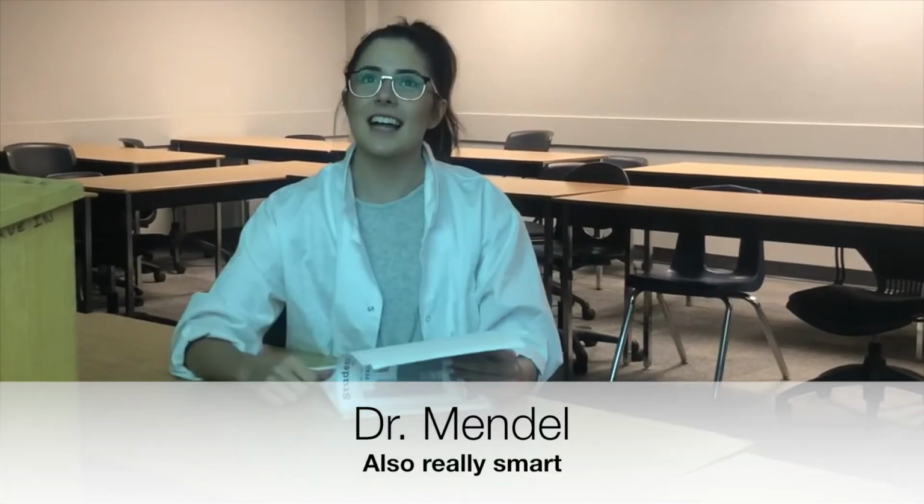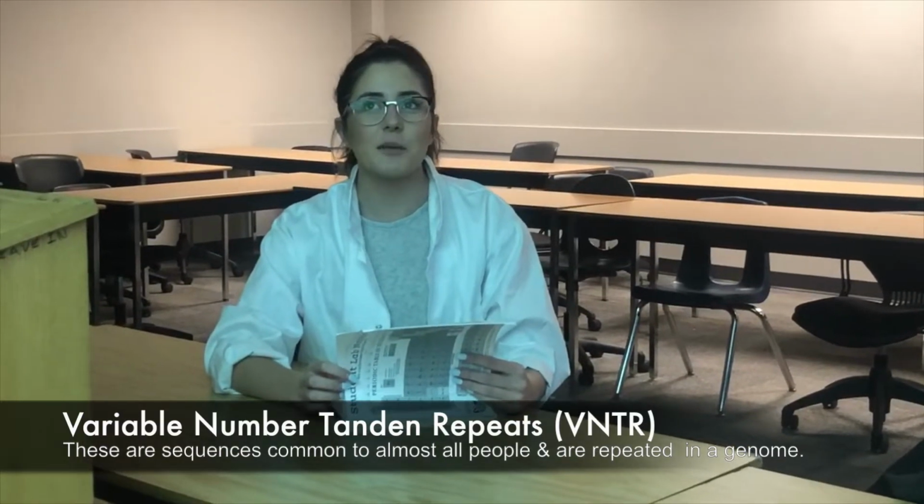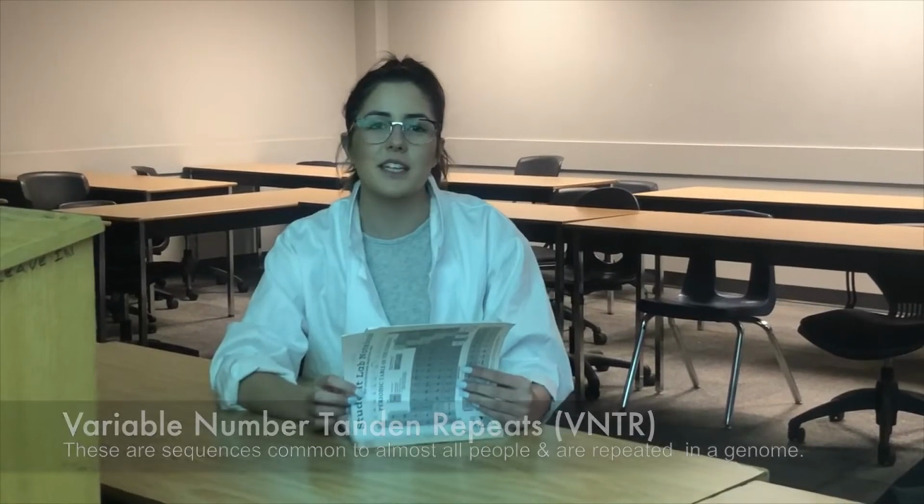The results of the forensic analysis were determined using variable number tandem repeats, known as VNTR. These sequences are common to almost all people and are repeated multiple times in an individual's genome. Interestingly, these sequences are the same within the population, but the number of times the sequence is repeated in an individual varies. The number of repeats are inherited in a Mendelian fashion and therefore can vary due to differences between your parents' chromosomes. Repeating sequences observed in this investigation are very specific to the individual and allow the individual to remain anonymous. So how does VNTR analysis even work?